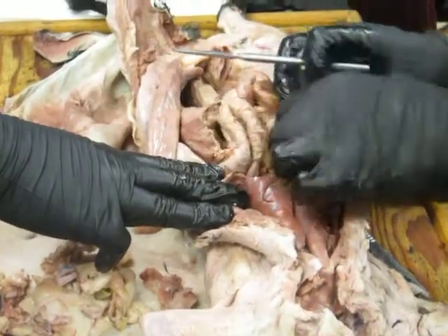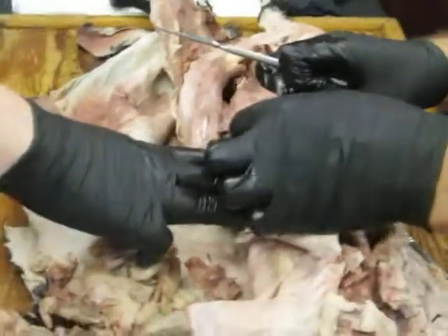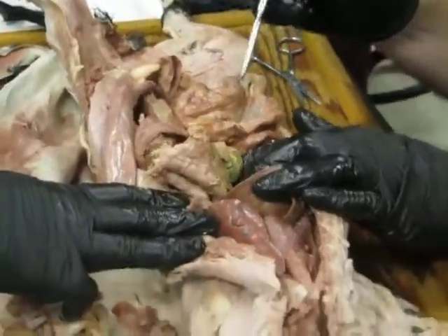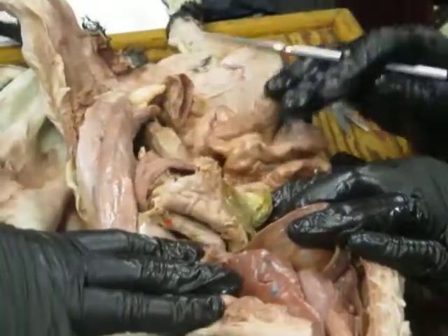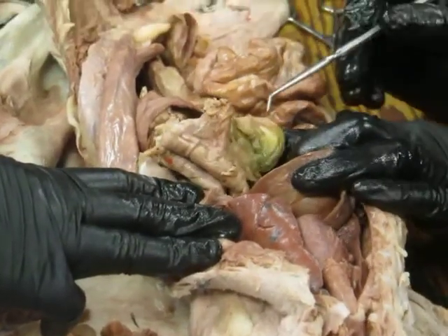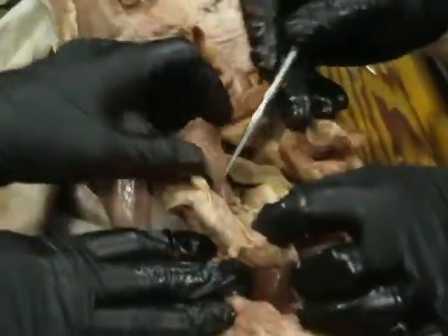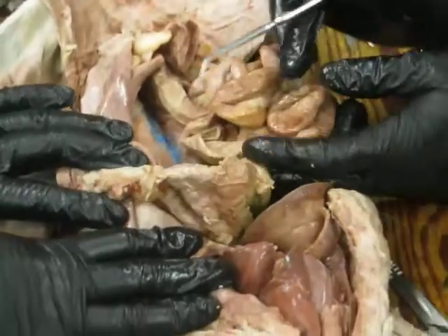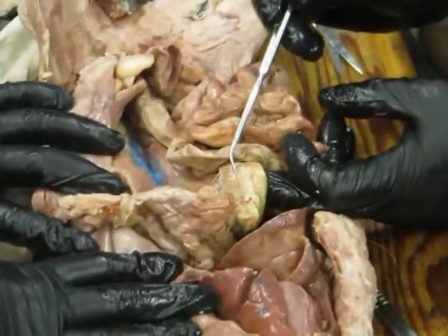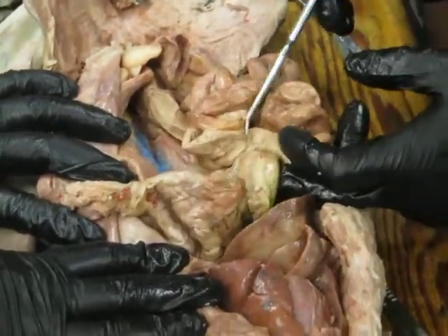Moving the spleen away, come back here, and we're going to follow down from the stomach, and we get to the duodenum here, the first section of the small intestine. And what organ do we always see associated with duodenum? Pancreas. Aha. So lo and behold, if I look right in there, here is pancreas right here. Nice. And in the cat, the pancreas is a fairly solid organ.